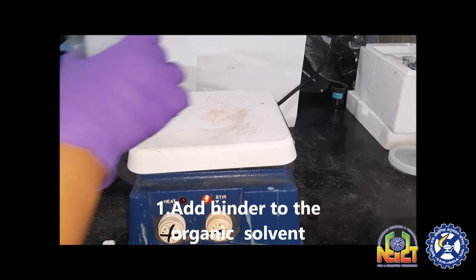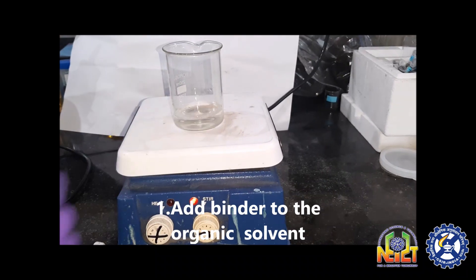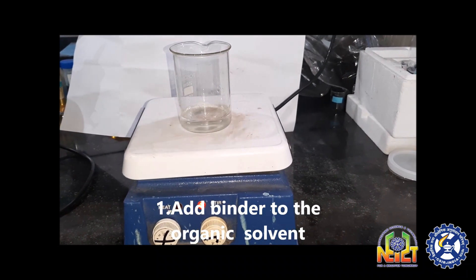To fabricate a supercapacitor, first add required amount of binder to the chosen organic solvent and mix it properly.